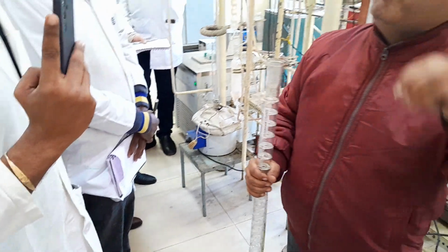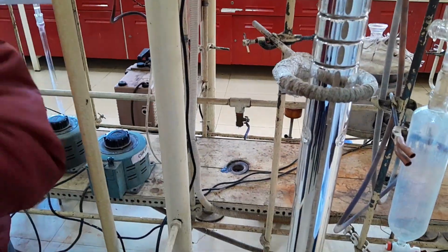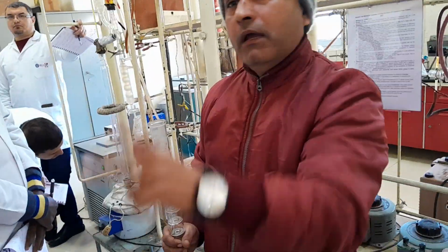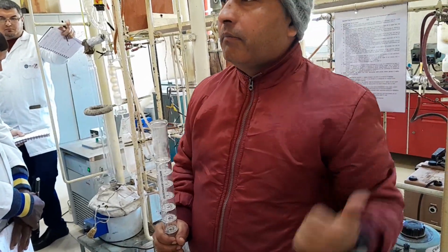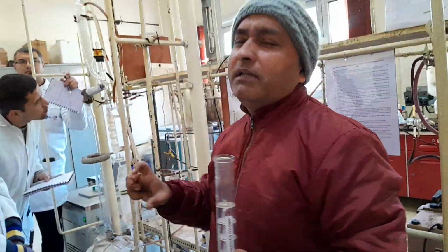And the work which I am doing with this column is not done by that automatic unit which costs 2 crores. Biodiesel and bio-oil cannot be distilled by an automatic unit because there is a sensor. If uneven boiling happens during the distillation, that unit will automatically shut down, saying your temperature is uneven. But here it is a manual unit and gives so much, costing only 7 lakh, but we have learned so many things with this unit. That is why it is very interesting.